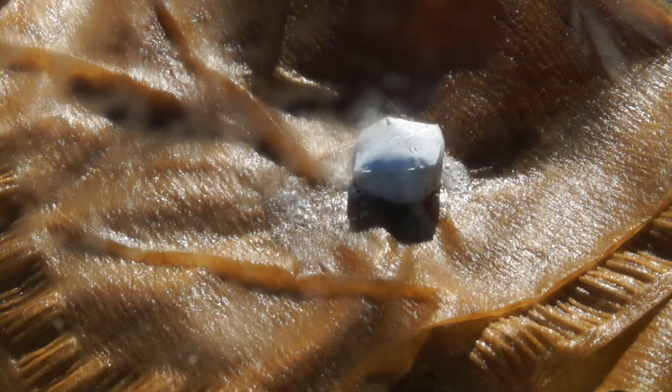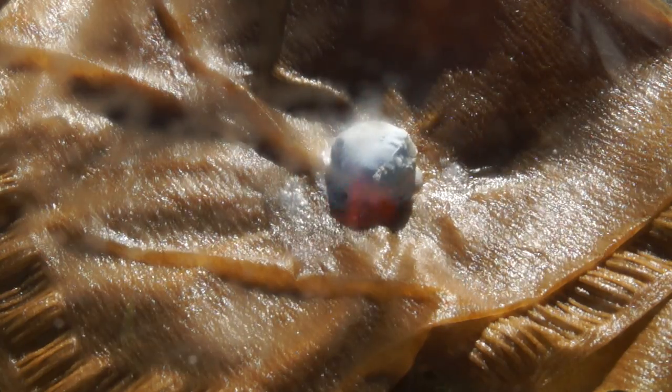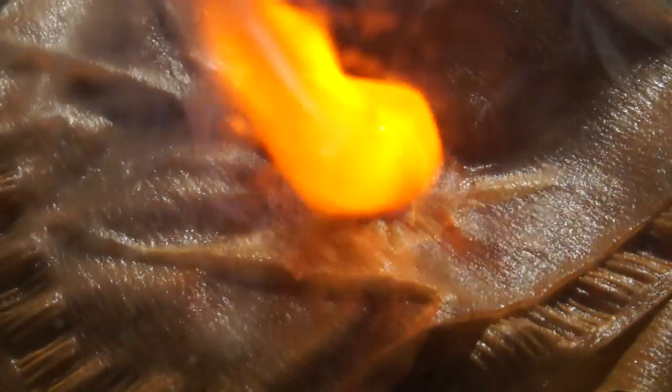I also managed to shoot the behavior of sodium on the surface of the wet filter. We can clearly observe the spheroidal state which the burning sodium droplet acquires after becoming transparent.